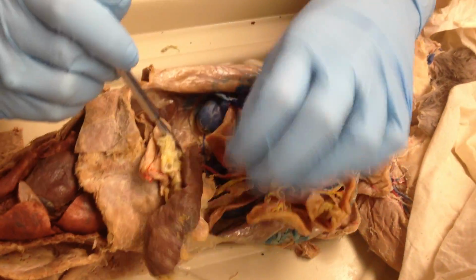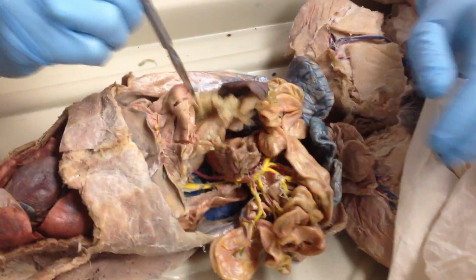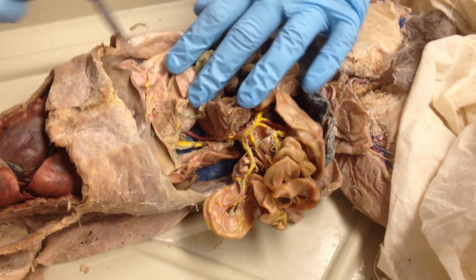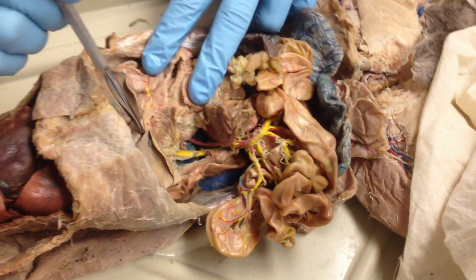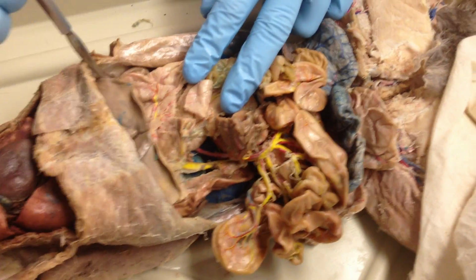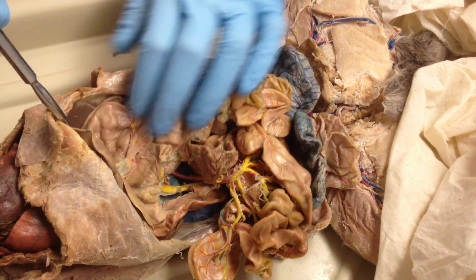Can you distinguish the sections of the digestive really quick? There's a video on that. Oh, there is? Yeah. Oh. Well, we can still go over it. Yeah. So what is this? The big, just generally. Thank you.